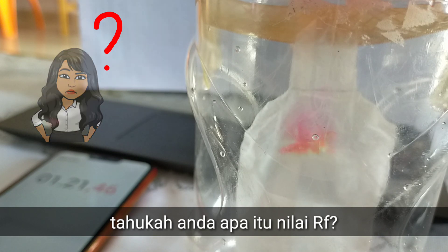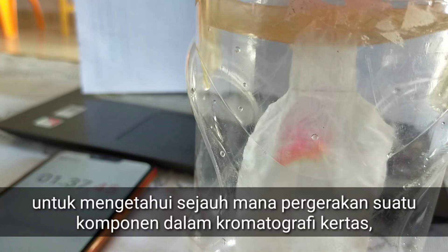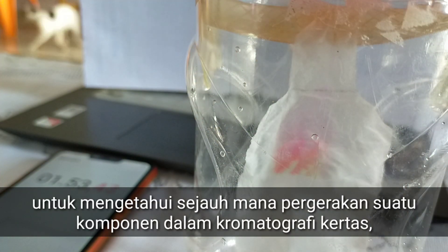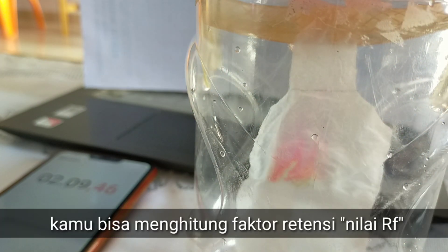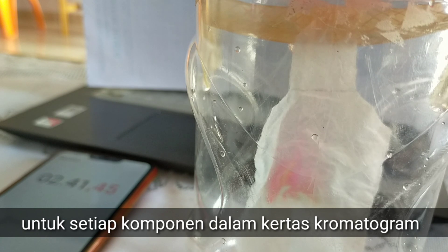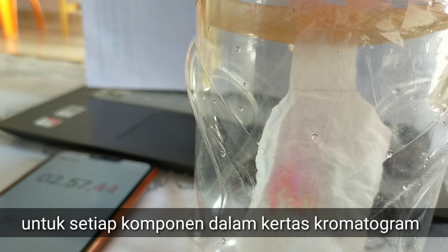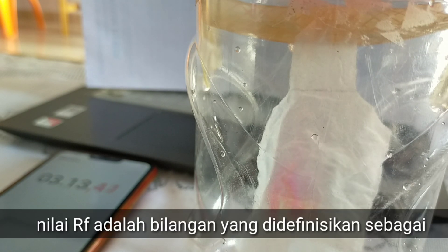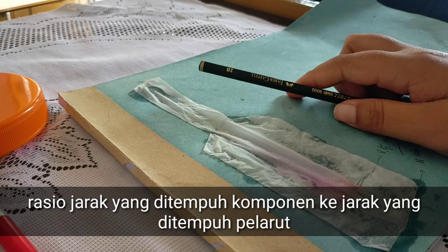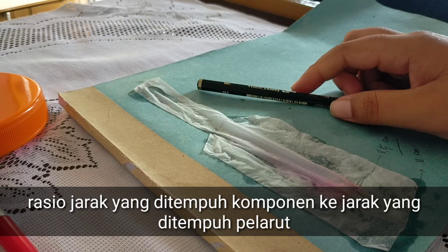Then calculate the Rf value. The Rf value, or retention factor, is used to measure the extent of movement of a component in paper chromatography. It is defined as the ratio of the distance traveled by the compound to the distance traveled by the solvent.